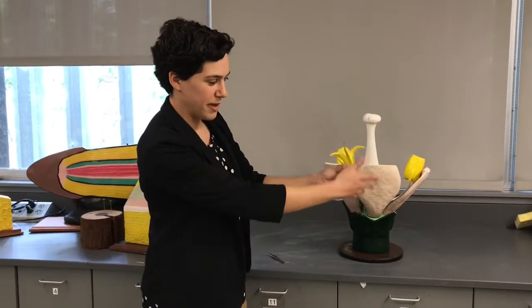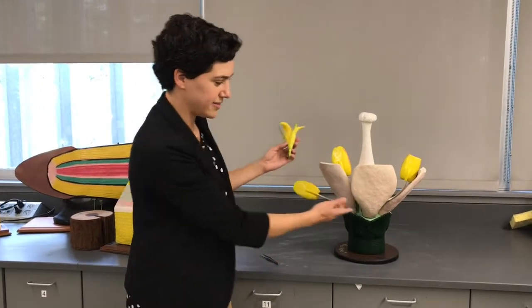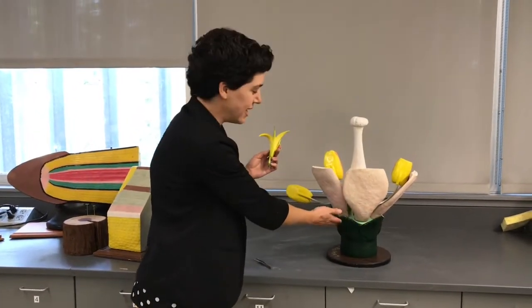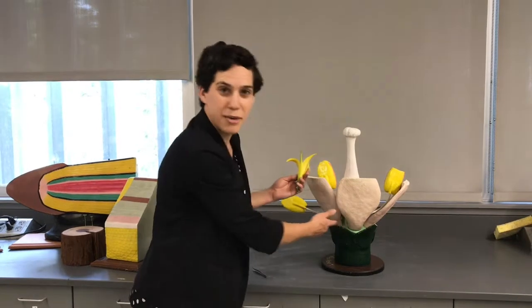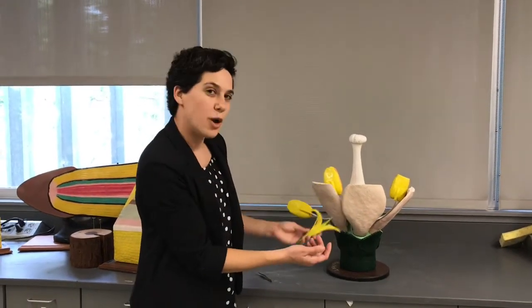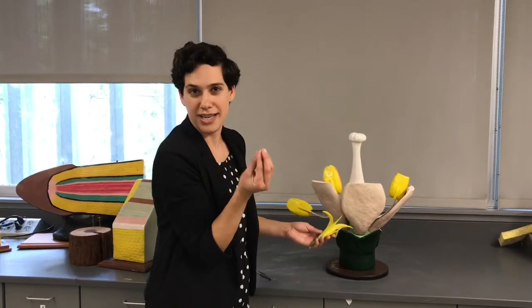When you look at a flower from the outside, normally the first things that you would see are the sepals, and a lot of times those are green, but not always. They usually help protect the flower when it's a bud before it opens.